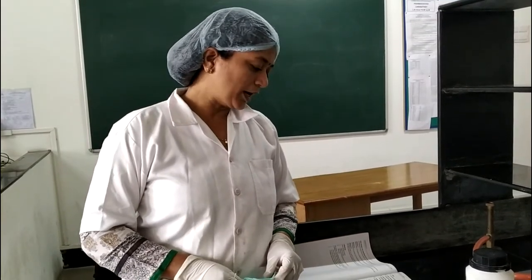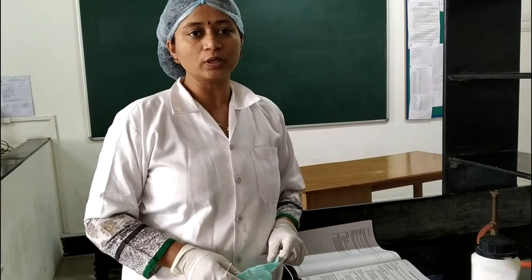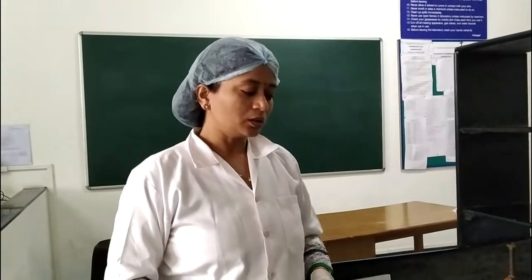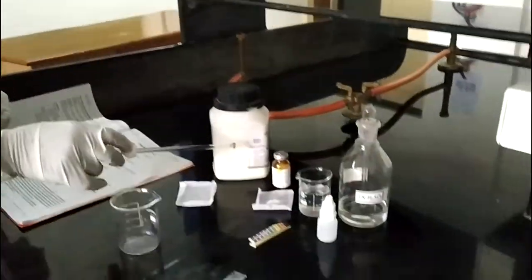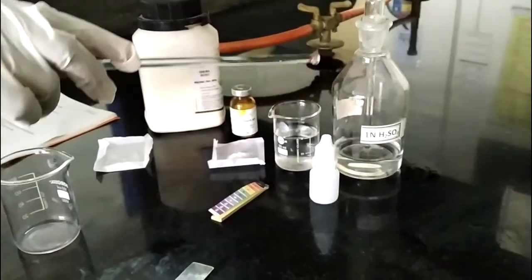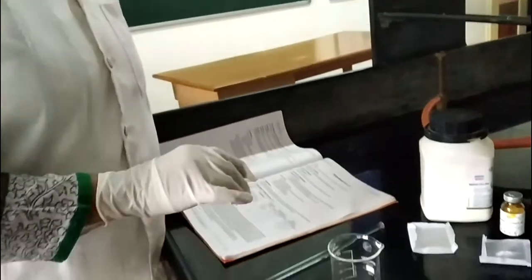Welcome, dear students, to the pharmaceutics first laboratory session. In this session we prepare atropine sulfate eye drops — 10 ml. The formula in our manual is given for 100 ml of atropine sulfate eye drops. Chemicals required: atropine sulfate, phenyl mercuric nitrate as preservative, purified water, and sulfuric acid to maintain pH. We wear a mask and use all aseptic techniques.